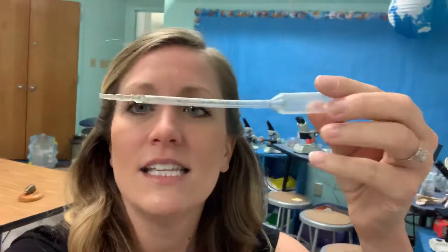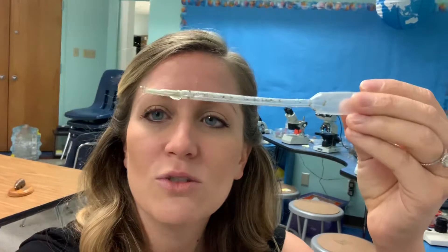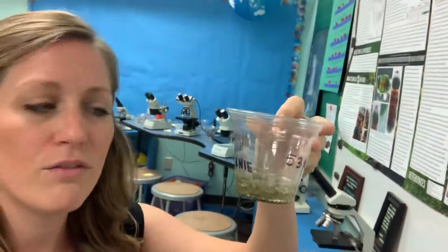When you get to how you're going to make your tardigrade petri dish, first of all, this is a petri dish. There are different sizes — I actually prefer the smaller ones, but these are the ones we have right now. And you'll need a petri dish, a pipette. This is a pipette — notice how it squishes things out. And you'll need your sample mixture of moss or lichen and water.